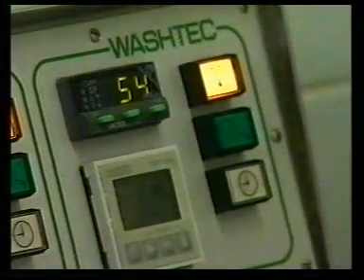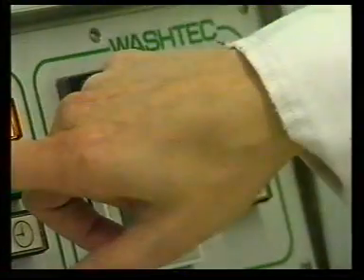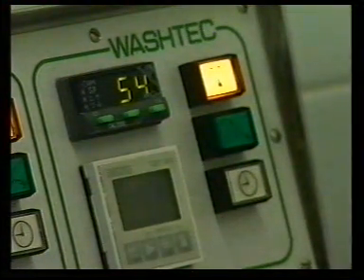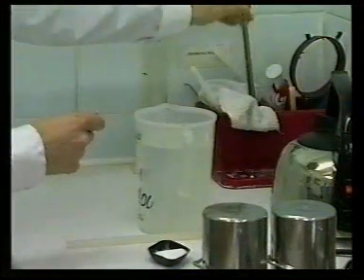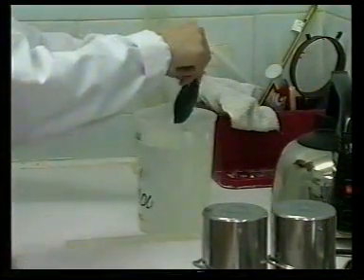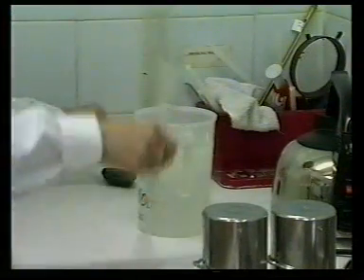The required temperature for the wash wheel is set and run for a short time to preheat the pots. The detergent solution is prepared and heated to the required temperature.